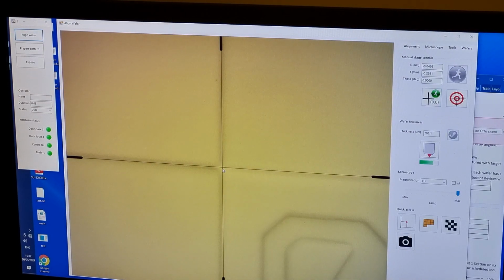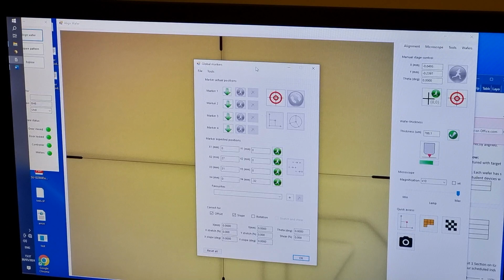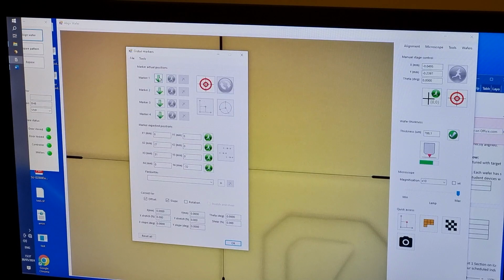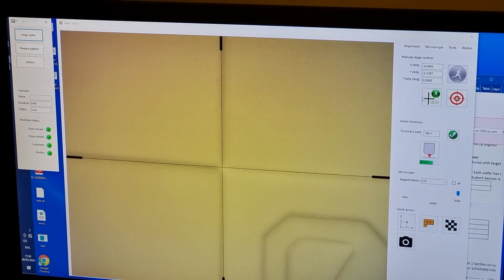The alignment window can be launched from the top left button in the Quick Access group. Under Marker Actual Positions, click the green down arrow. This records the current crosshair position as the first marker position. Now, under Marker Expected Positions, ensure the first set of coordinates match the expected alignment location of 0, 0. Clicking on the green Running Man button will make the microscope move to that position. In this case, it should move to the 0, 0 location from the first layer.